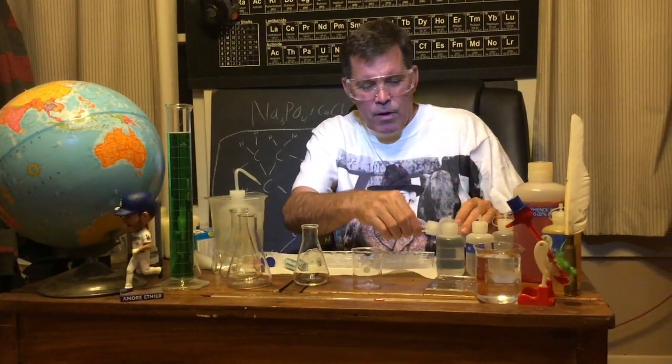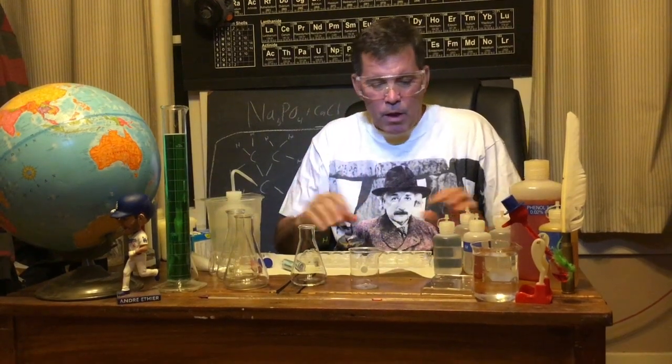Oh, hi. Welcome back to my lab. You can sit right over there if you like, but you'll have to put those goggles on. You can actually help me out today because I'm doing all kinds of fun experiments and I need you to write down your data. So you have a sheet like this right in front of you. If you would collect your data on that, that would really help me. So I'll do the experiment and you collect the data. Thanks for putting your goggles on.